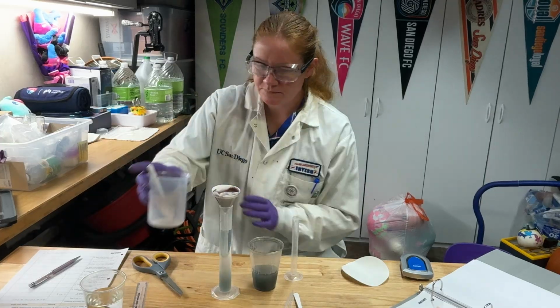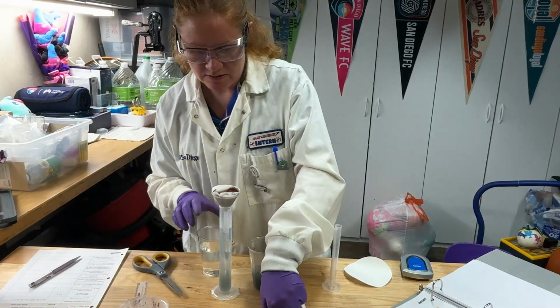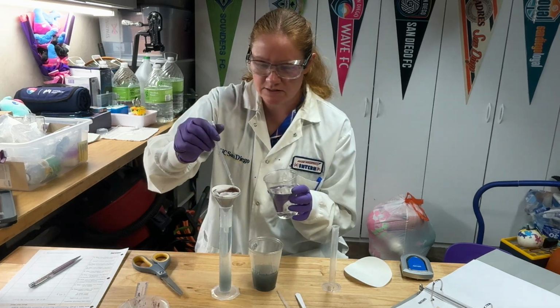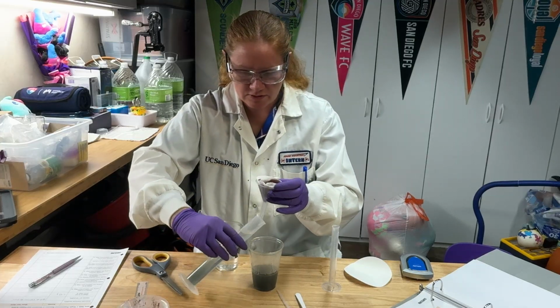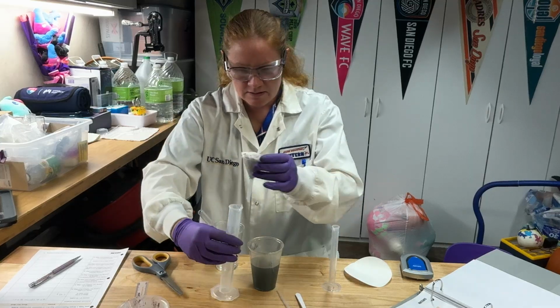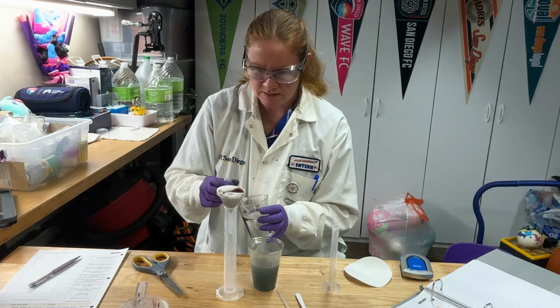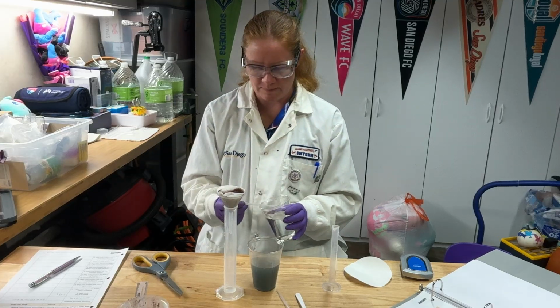Okay, now, once you have all that out, you do want to wash what's in here with some water. So that's where you take a plastic pipette, and I'm just going to wash the edges of this, wash the center of it. Oh, I'm getting a little full. It's not going to drain as well, so I'm going to go ahead and pour this out into my waste container here. All right, rinse my sides. And do this for about 20 mils of water.